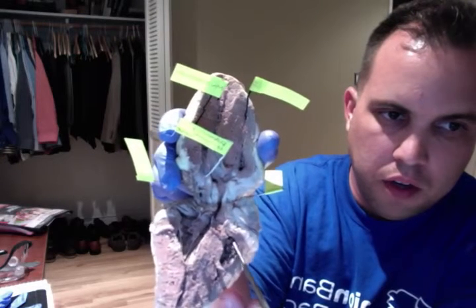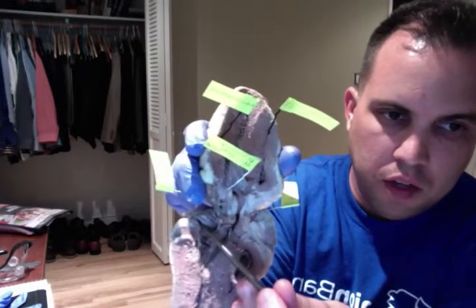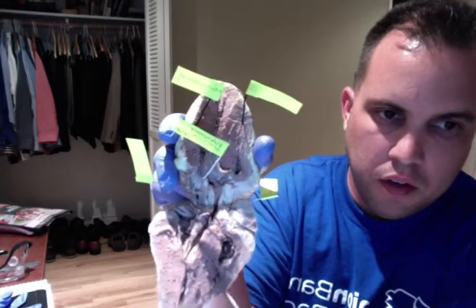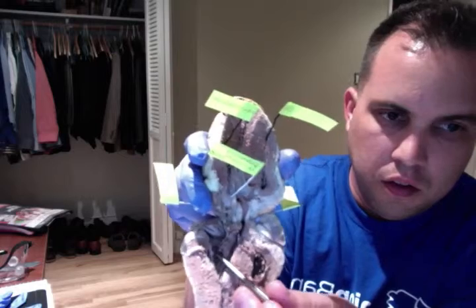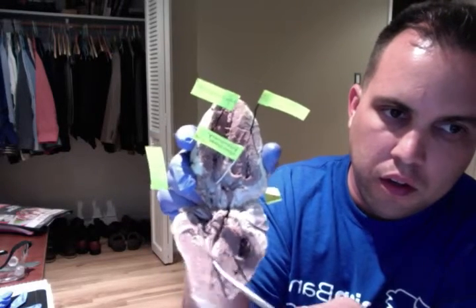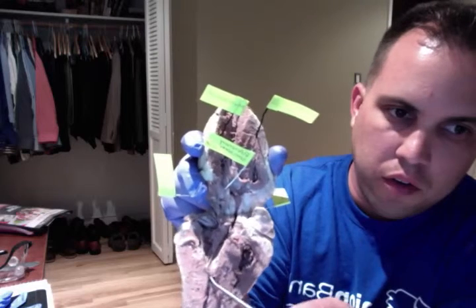Right atrium over here, left atrium over here. Right ventricle down here, and left ventricle over here.